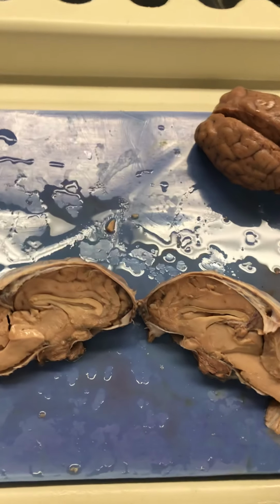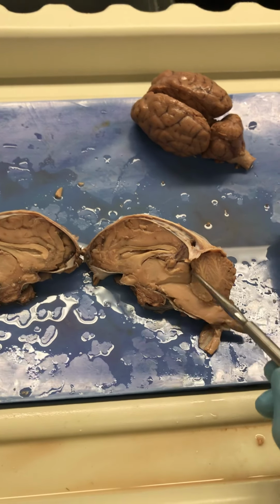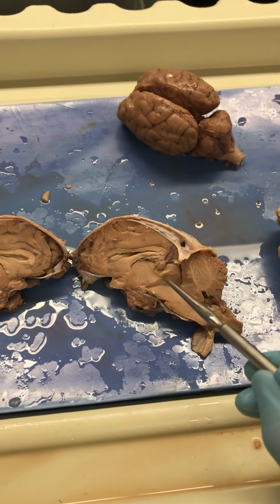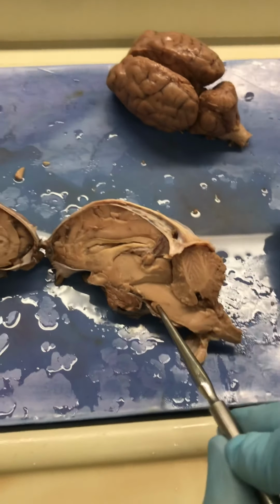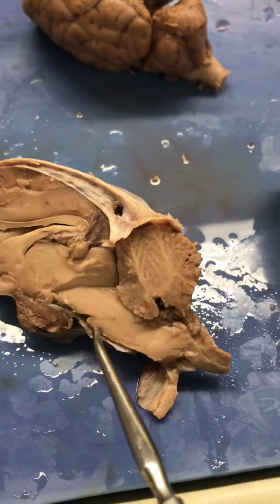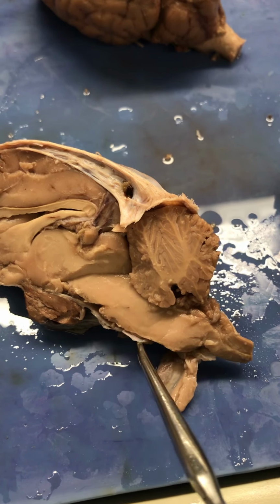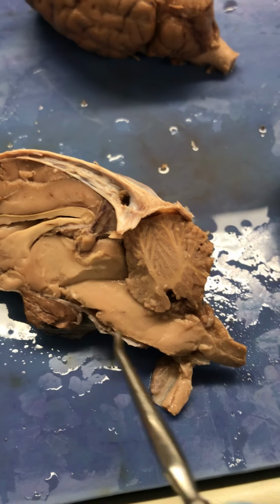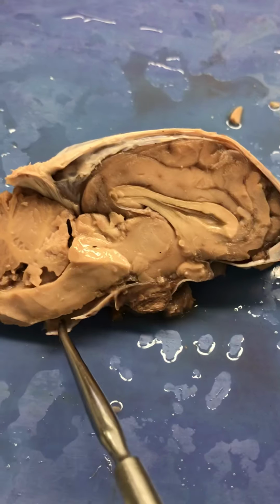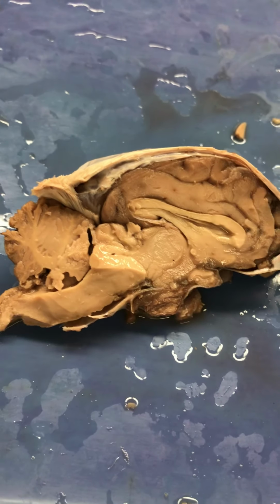And now let's move down to the brainstem. The midbrain oftentimes is included as part of the brainstem, even though it comes from a different embryonic origin, tit for tat. But this is the pons right here. Do you see this kind of belly that sticks out? That's because there's a lot of fibers here that connect the pons and the cerebellum to the rest of the brain, and so it's not so pretty, but that's it. It's going to have a little belly.